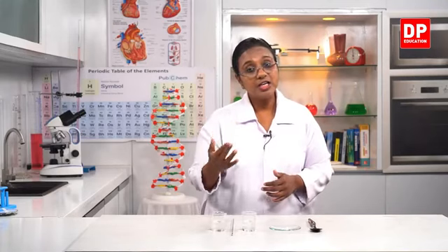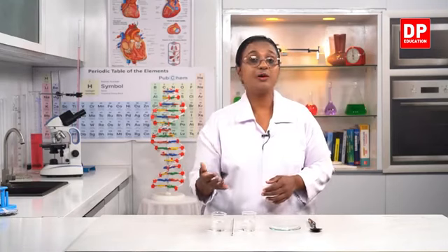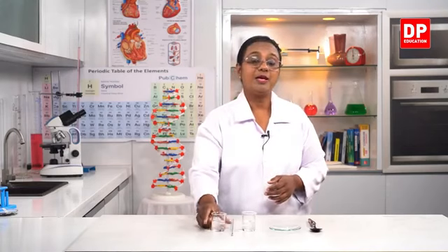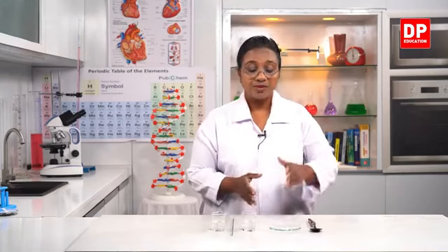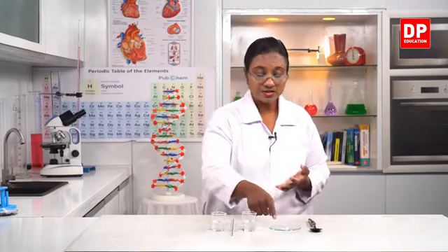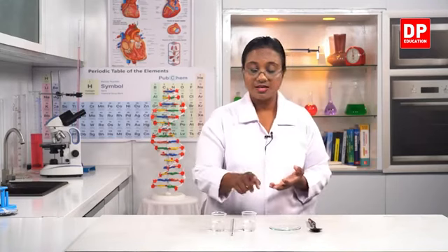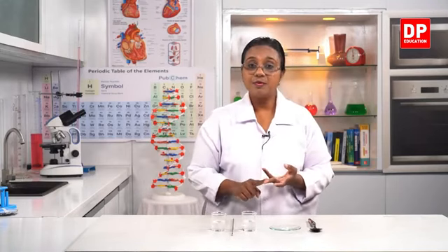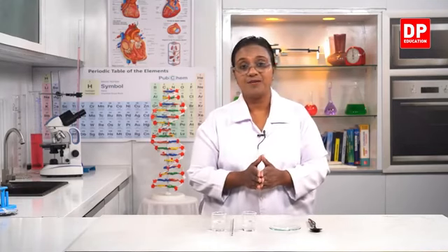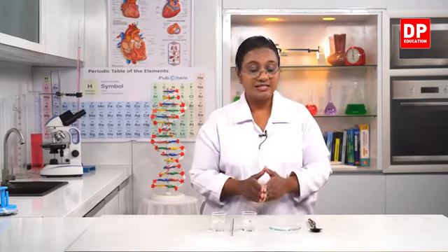Then in the last one, again you saw the dissolving of the magnesium strip. You saw the liberation of gases. And also I told you all, when I touched the beaker, you can feel it warm. You were not able to see that, but I felt the beaker becoming warm. So there was a change in temperature. So the substances burning with different colored flames, then the production of new substances with different characteristics, then dissolving of substances, change in temperature, then liberation of gas, and again change in temperature. All these are observations that help us to identify a chemical change. So from these, students, I am sure you all can understand a physical change and chemical changes.